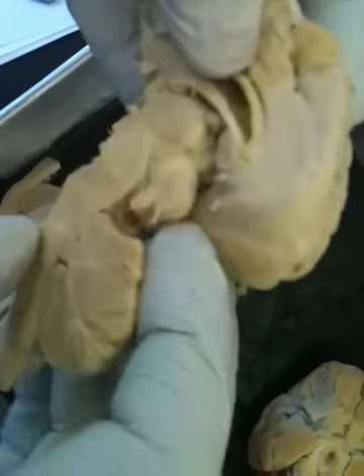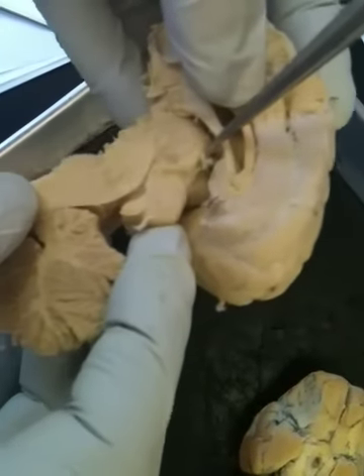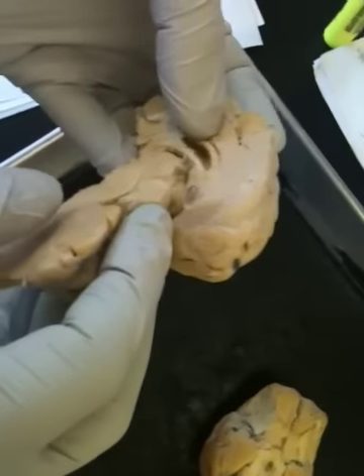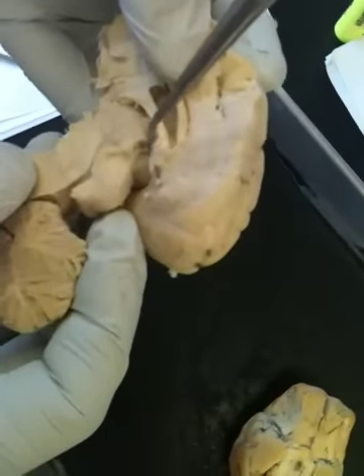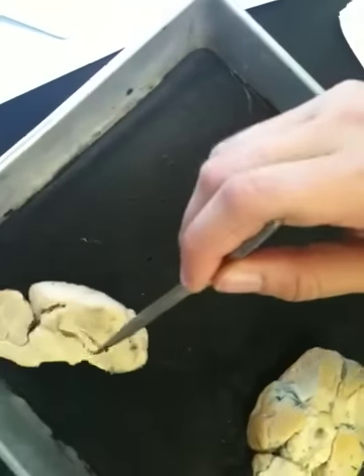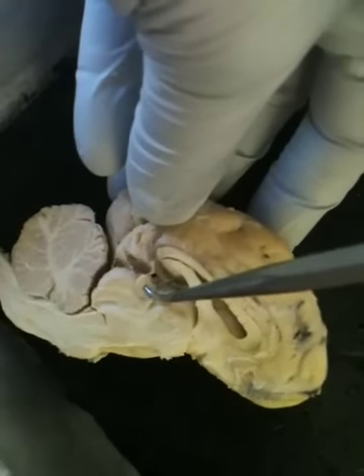Can we see it on this one? Right there. That's the pineal gland. Yeah. It's supposed to be like above here. Basically, you cannot really see it. Can we see it on this one? Here you can see it. Oh yeah, it would be that knob right there. Oh yeah, there we go. That's the pineal gland.